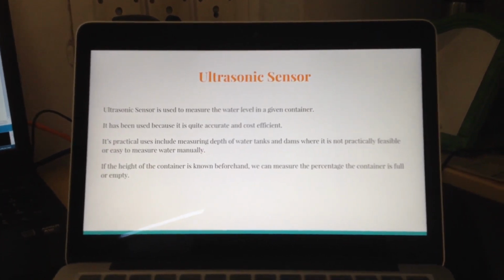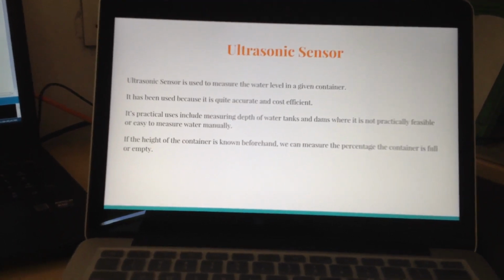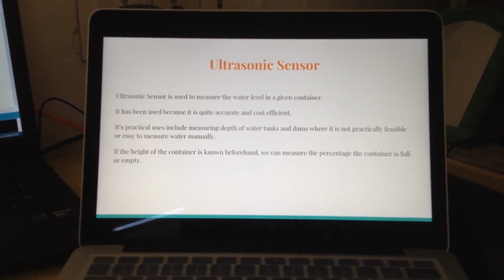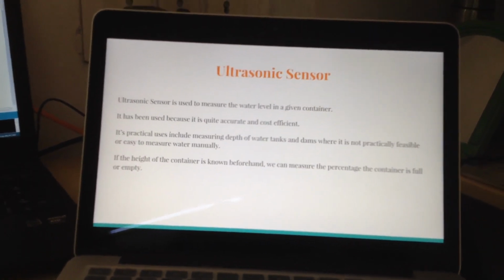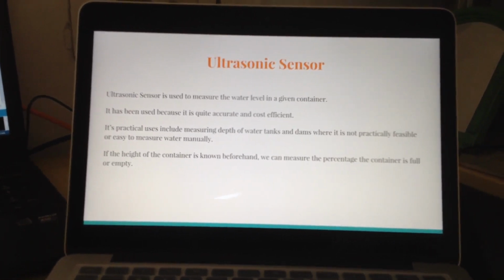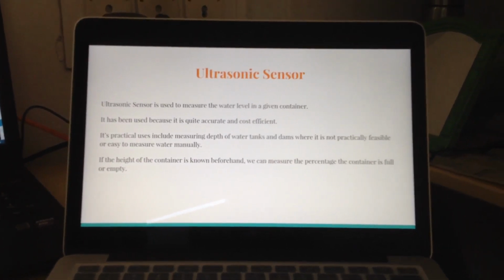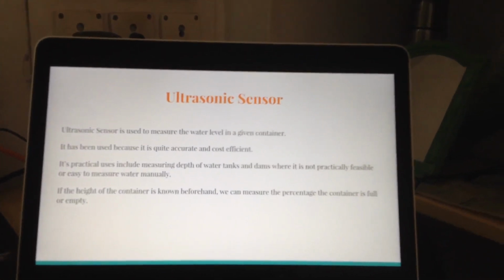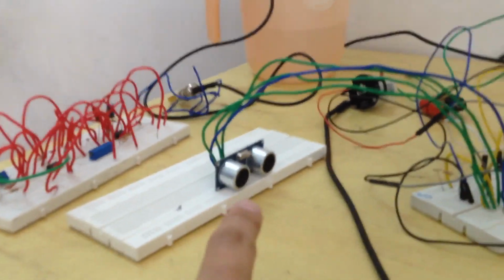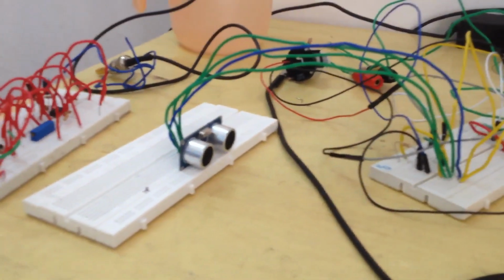One might argue, how is the water level a parameter of water quality? So this was just an extra addition to the overall project. Many times we would want to detect the level of water which is left in a tank. It might be important during summer when it often happens that the water levels fall below the ideal level. So this sensor works on a very simple principle. This is the tiny thing which basically emits ultrasonic waves which travel at the speed of sound.